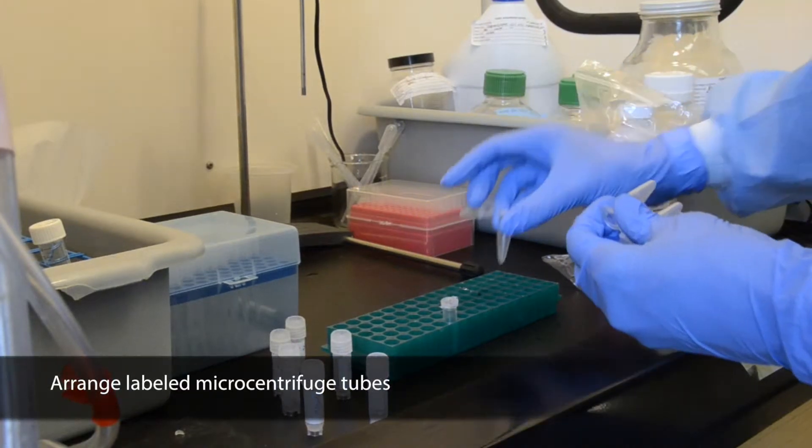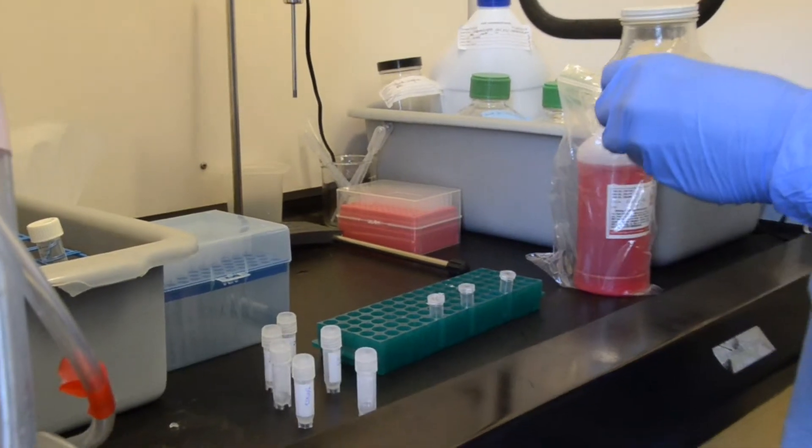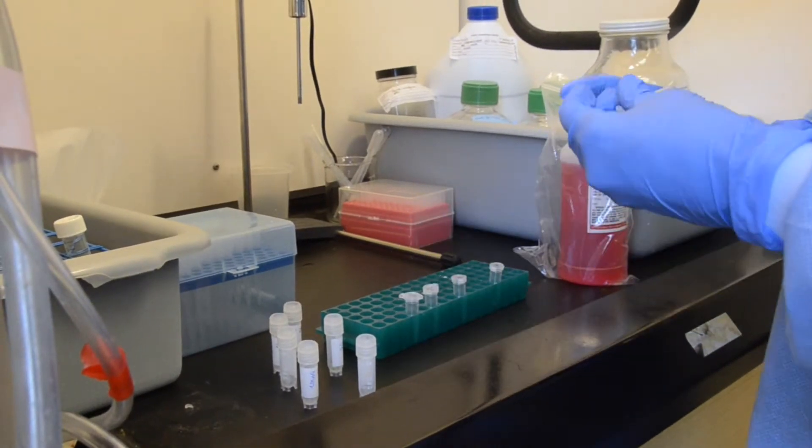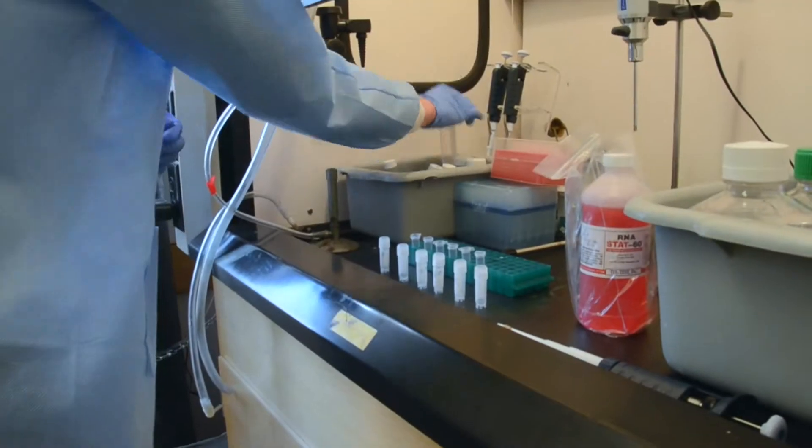Before starting, make sure that ethanol has already been added to the wash buffer concentrate. Additionally, make sure there is enough chloroform and ethanol in the respective falcon tubes in the hood. More can be found under the hood if necessary.